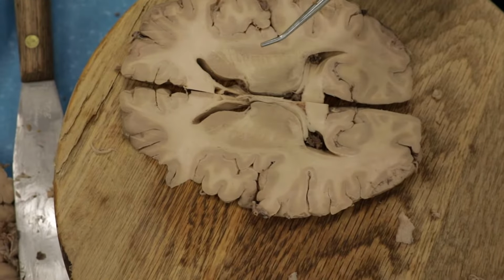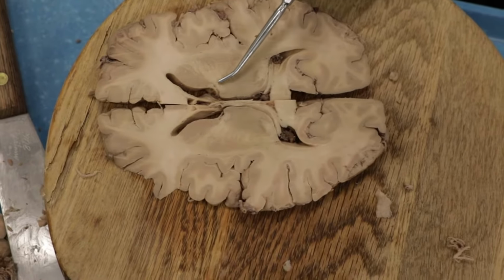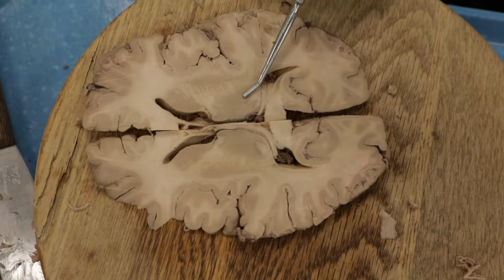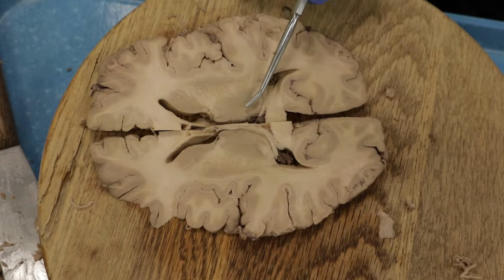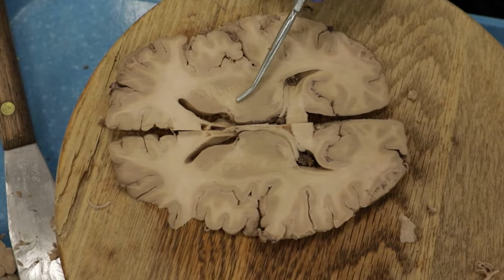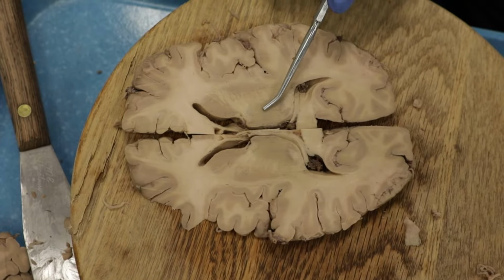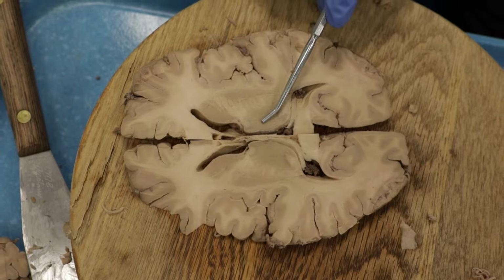Okay, also medial to the internal capsule, this time to the posterior limb, is the thalamus. The thalamus we've referred to as the executive secretary. Any information going to the brain is processed through the thalamus, except sense of smell. Everything else has to go through the thalamus. So vision, sensation, auditory information, you name it, it all relays through the thalamus.